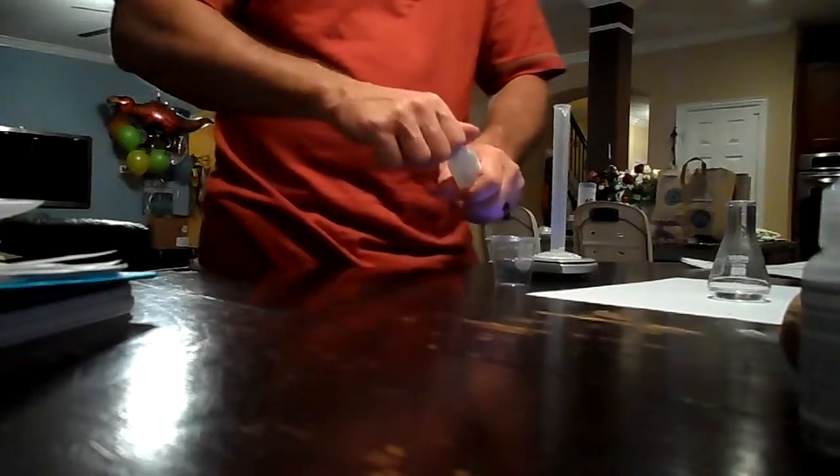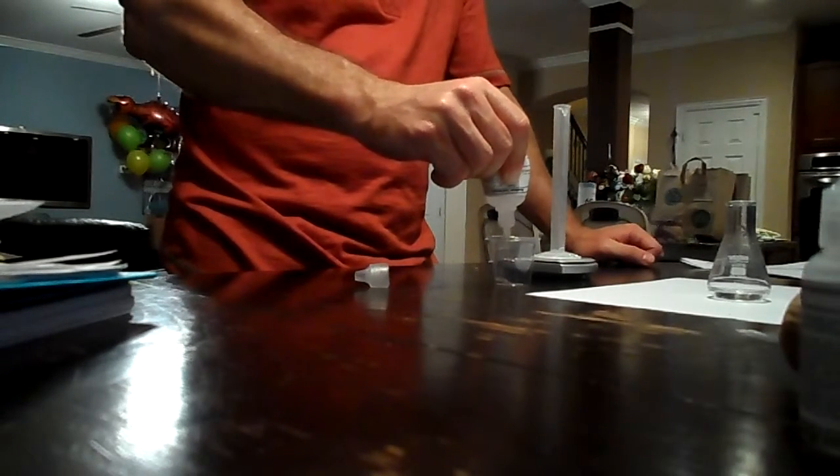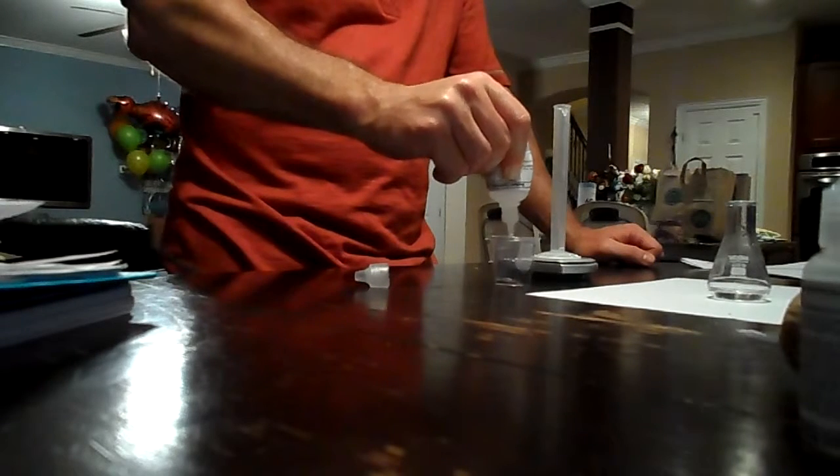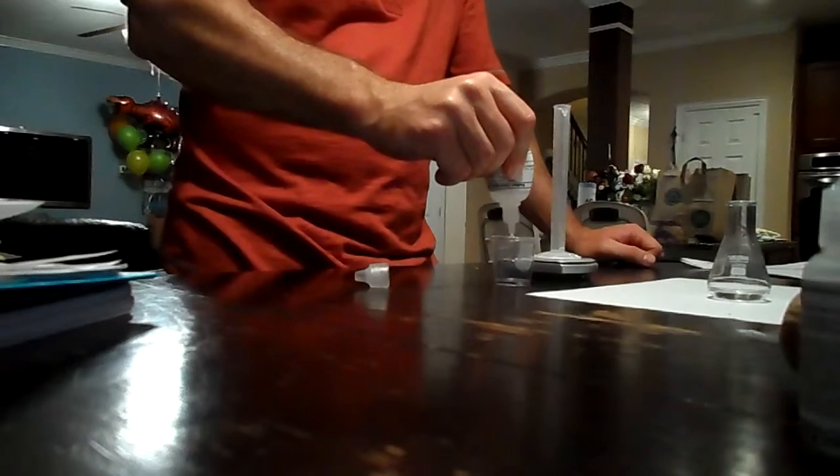But we're not going to use it all because it transfers to a syringe, fill a syringe, and record the initial volume. It's going to be by the 0.1, so I don't think we're using the whole 10 milliliters. Because it says fill the syringe with the solution, record the initial volume. Place the flask, add from the syringe in 0.5 increments.